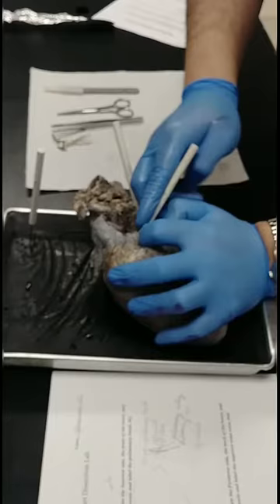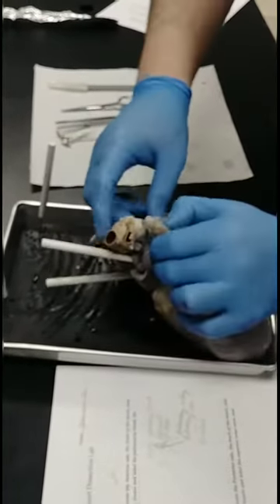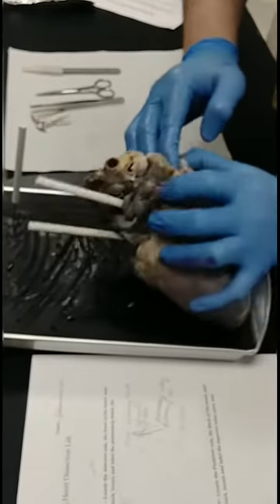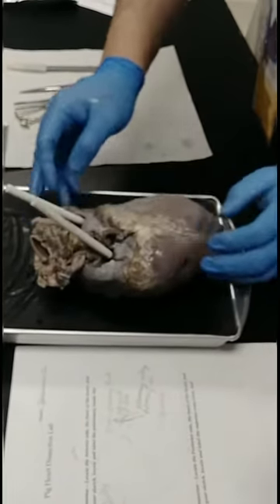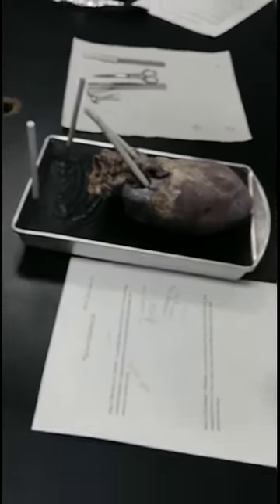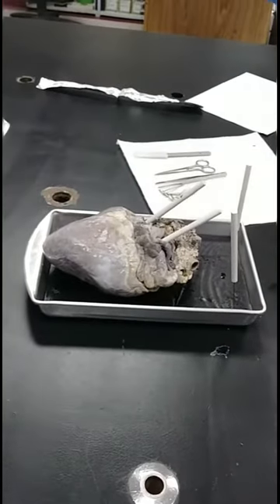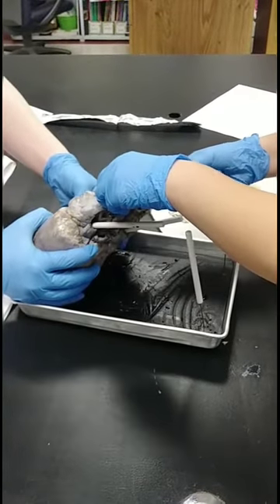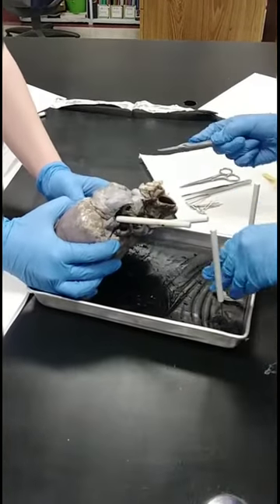You found the pulmonary artery — it's thick. This is the aorta complex up here. So you're going to describe that, draw that. Use your scalpel and get rid of some of this fat surrounding the pulmonary artery. You can see it.